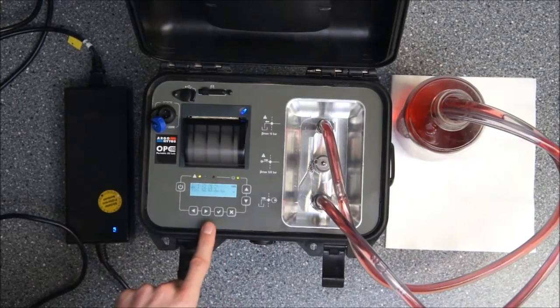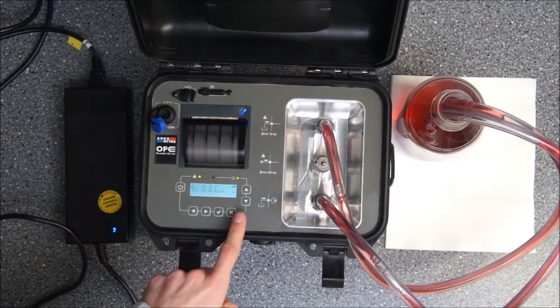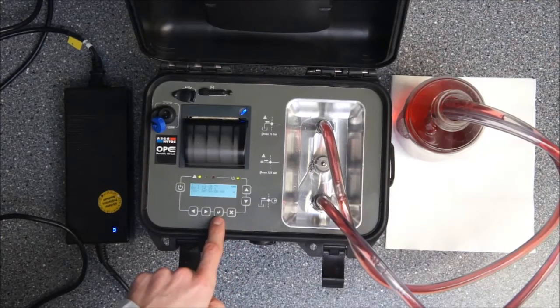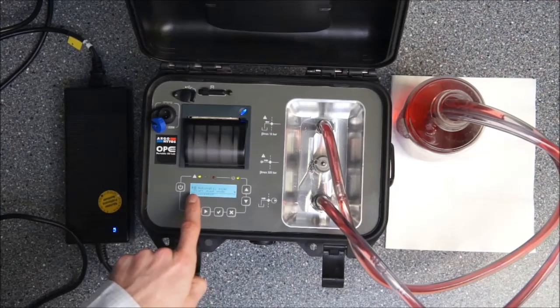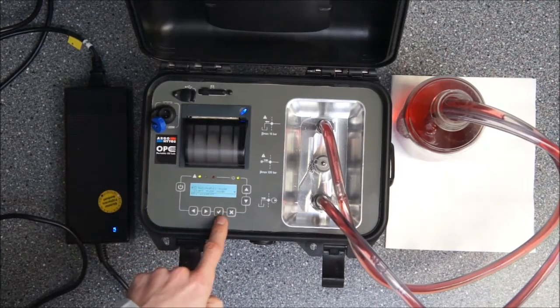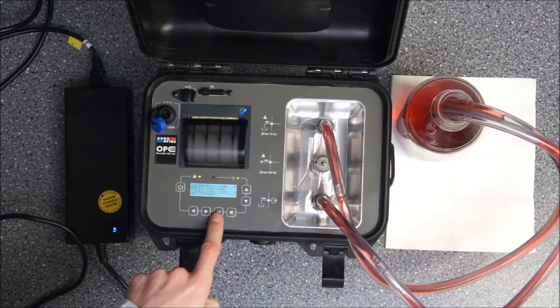After the unit is powered up we will start a measurement with the pump by pushing the enter button. You see currently there is an automatic mode selected. I just deselect that one and start a single pump measurement.